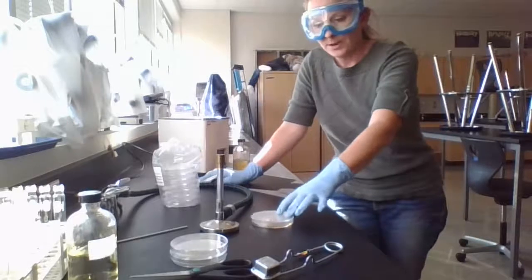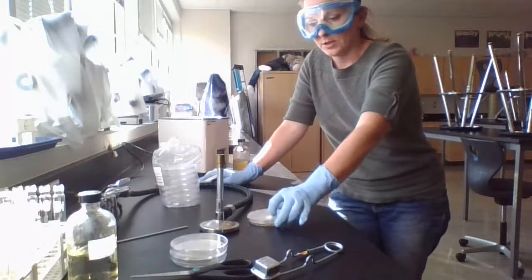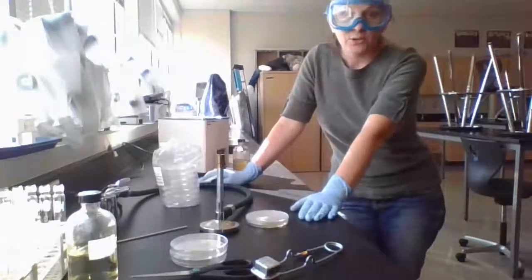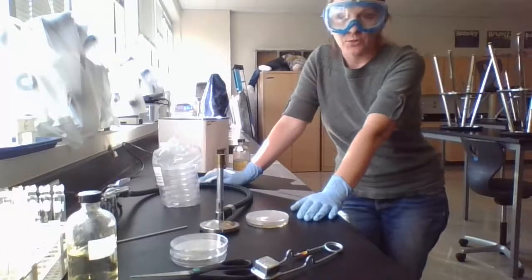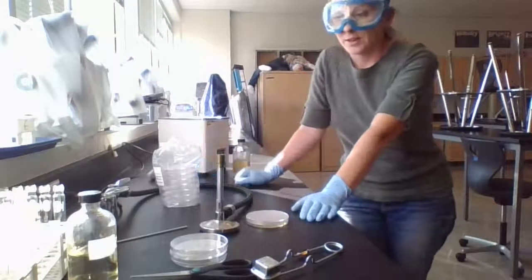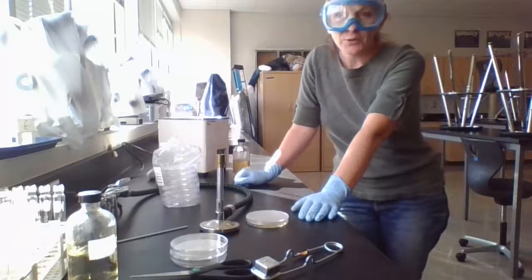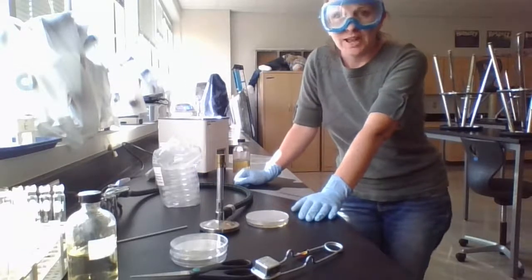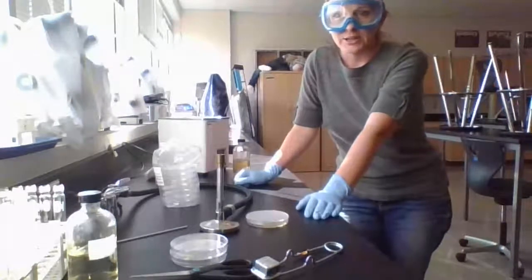It's just going to cool for a little bit. You might want to just make sure that it's covering all the part of the plate, and it's just going to cool. It might take about 30 minutes or so to cool, and then we'll be able to spread it with some bacterial cultures. And I'll show you how to do that next. We'll be using an agar slant and inoculating this plate with our bacteria.